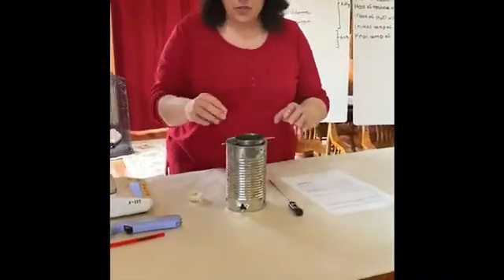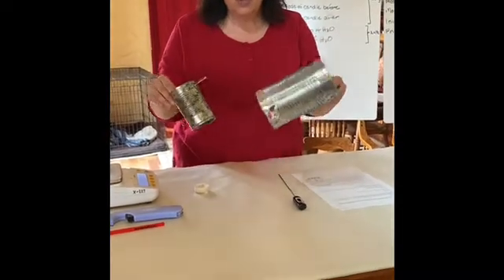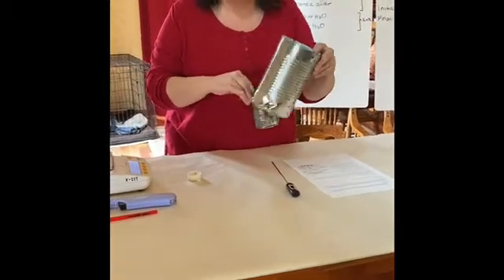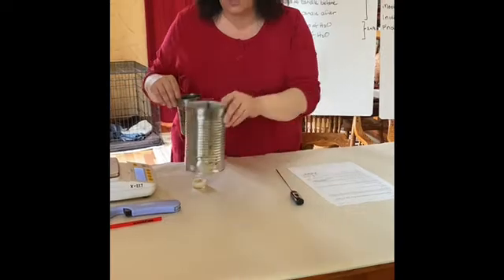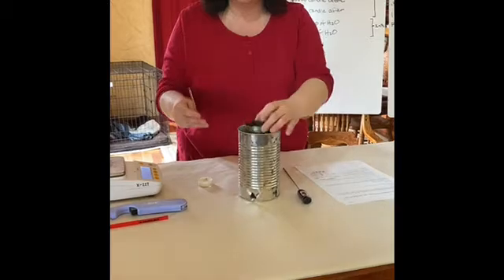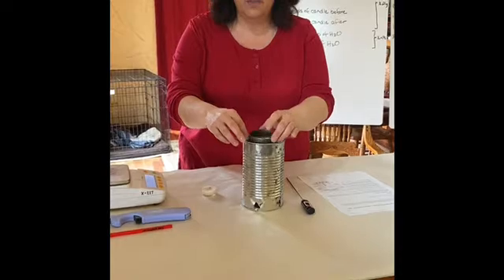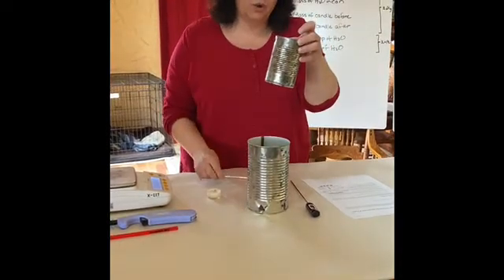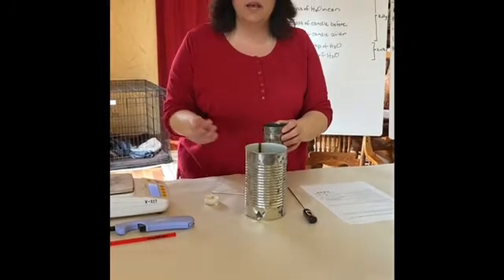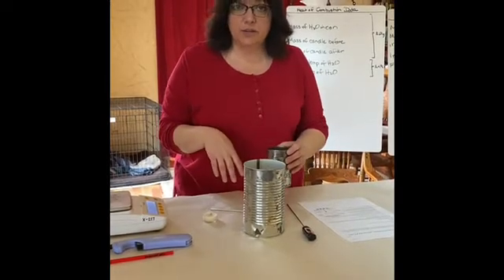So for heat of combustion, we're going to use this calorimeter that's called a chimney. There is a bigger can on the outside. Notice the diameter is pretty large and it's got holes cut in it. That's so that we can get air to the candle, which is going to be in the bottom. We have a smaller can that gets inserted into the larger can and is held above the candle with a glass stirring rod. This smaller can is where we're going to put our water. We're going to let the candle burn for about 5 minutes, see how high the temperature of the water has risen, and then we'll use that to collect our delta H.